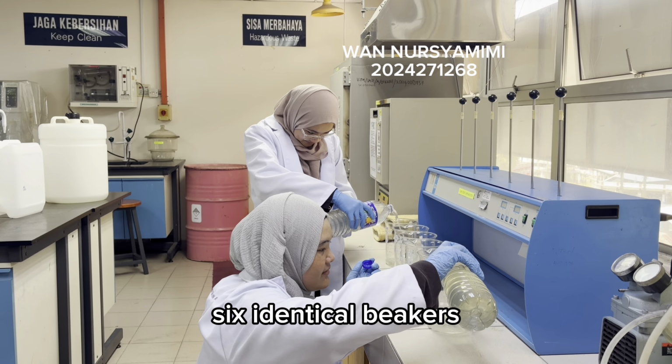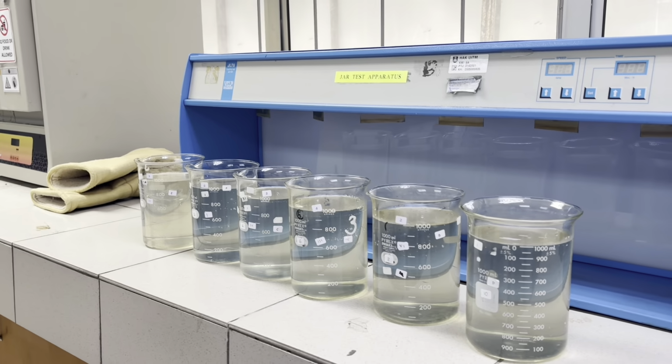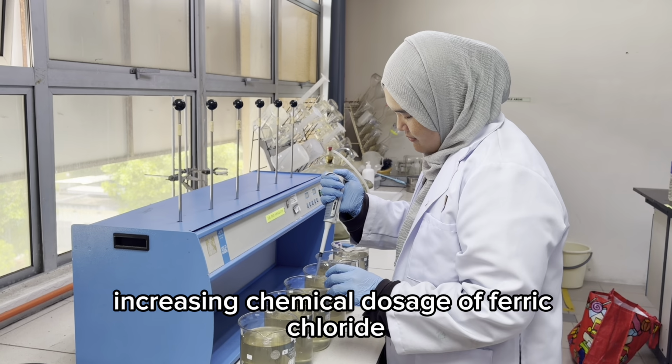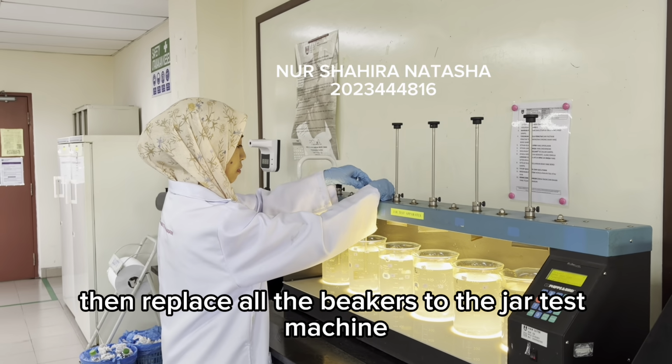Six identical beakers were filled with equal volumes of the raw water sample. Each beaker was treated with incrementally increasing chemical dosages of ferric chloride. Then we place all the beakers in the jar test machine.